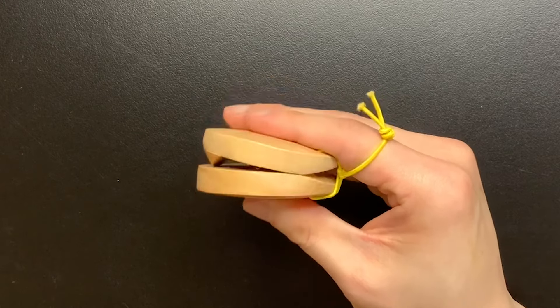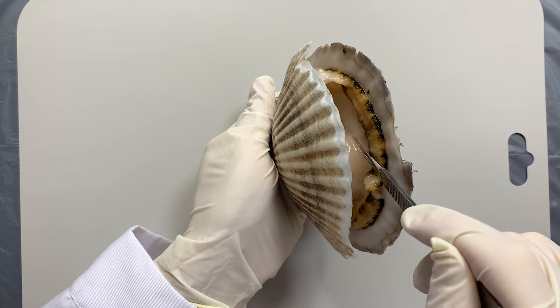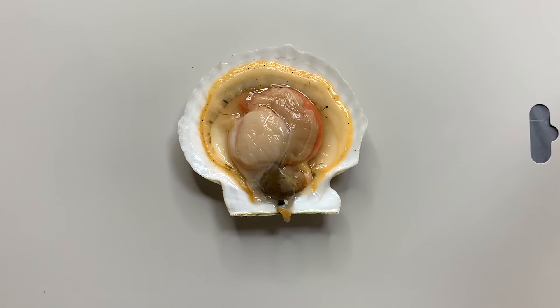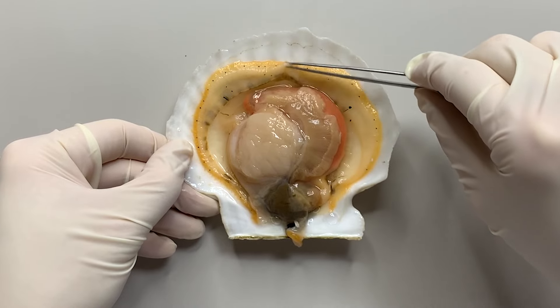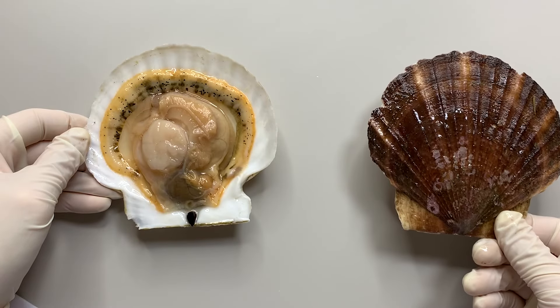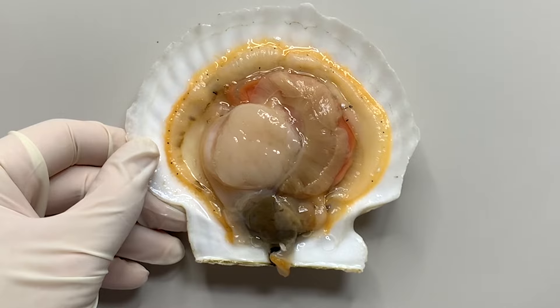To figure out how the shell closes, you have to look inside the scallops. If you cut off the part that holds the two shells, it opens in half like this. This part attached to the shell is the mantle. This is the muscle part of bivalvia called the adductor muscle. The adductor muscle of bivalvia is firmly attached to both shells.